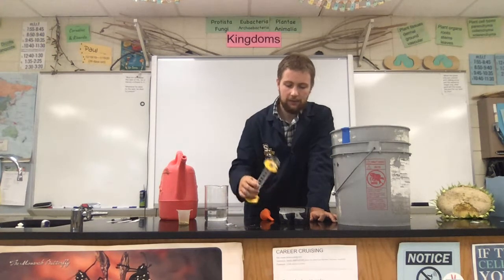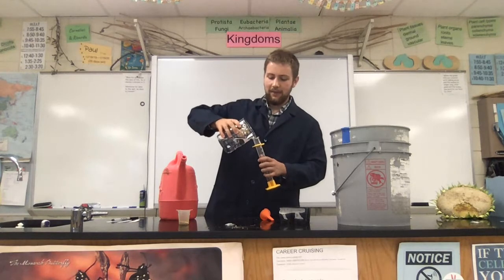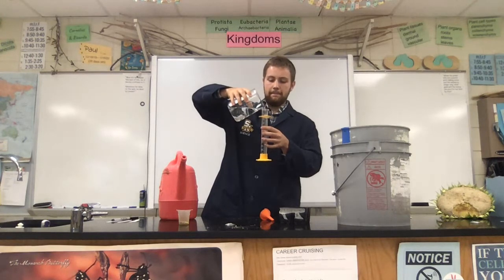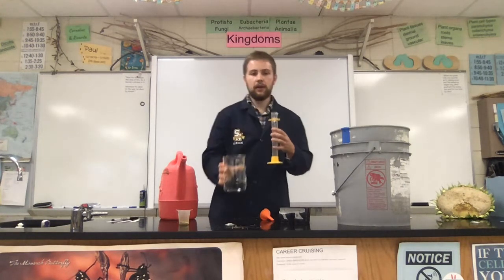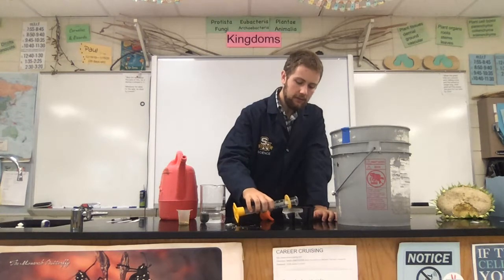Okay, we have reached our 50. I will now measure out another 50 for that other side, and I would say at least half of that water honestly might have come out the bottom end. So 10 seems to be more realistic, which is why we called it our normal amount, right? So let's go ahead and add our 50 to the other side.